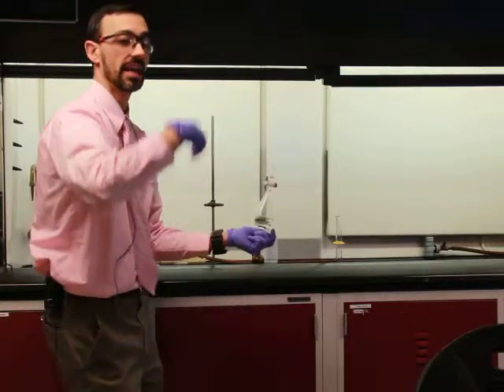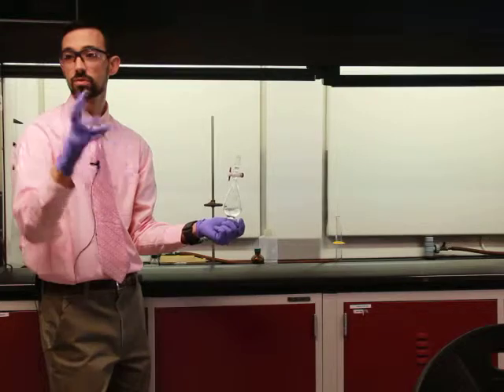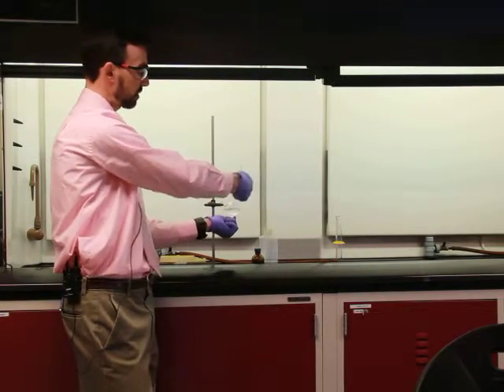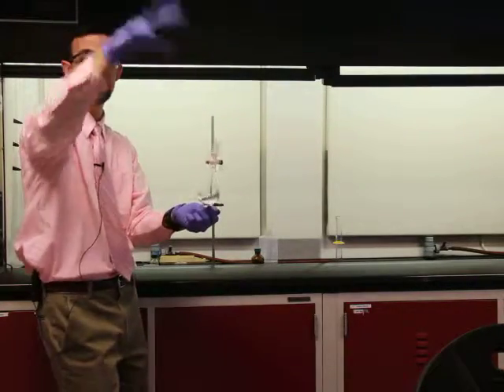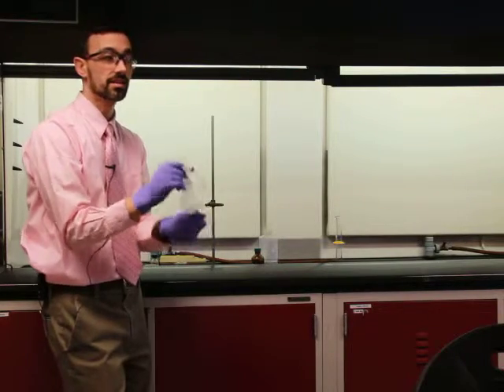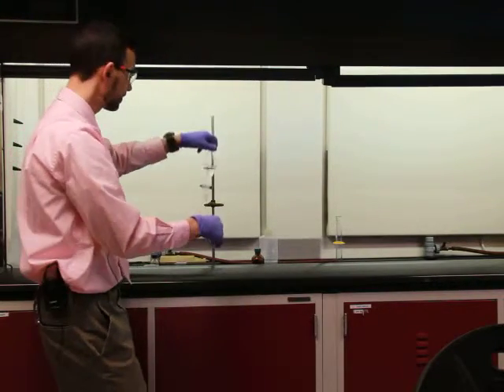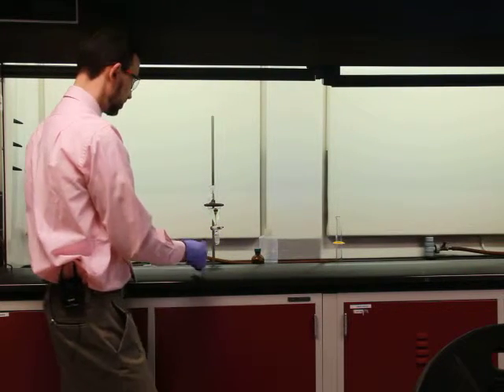Here, I'll hand off the acid molecule to the water and base, with the base that's in the water, okay? And at that point, it stays in there. Now notice this is good practice. I'm always pointing this away from me or away from other people, because it might spit out, right? These are just practical considerations, so we're not idiots in the lab in how we treat each other and our equipment, okay? All right. And this will now separate itself, and I'm now ready to pull apart the mixture.